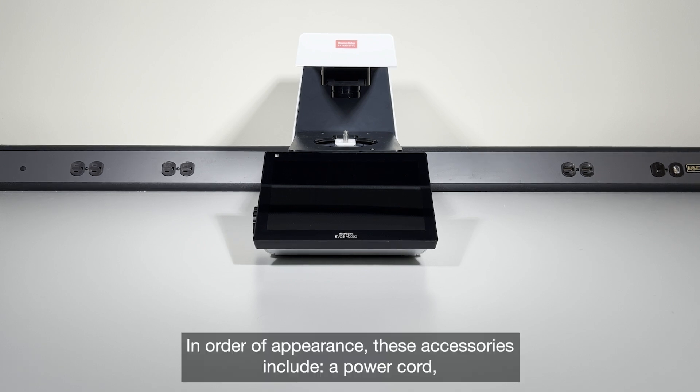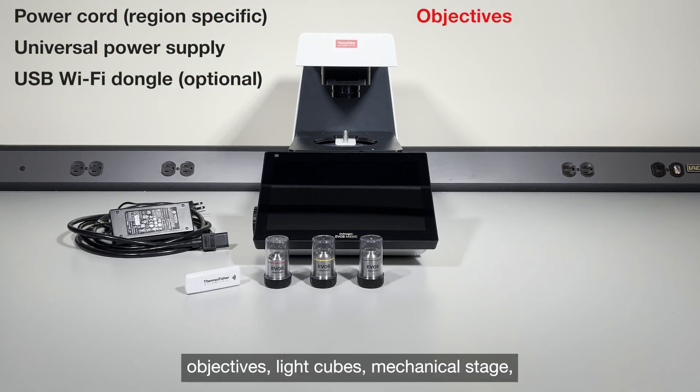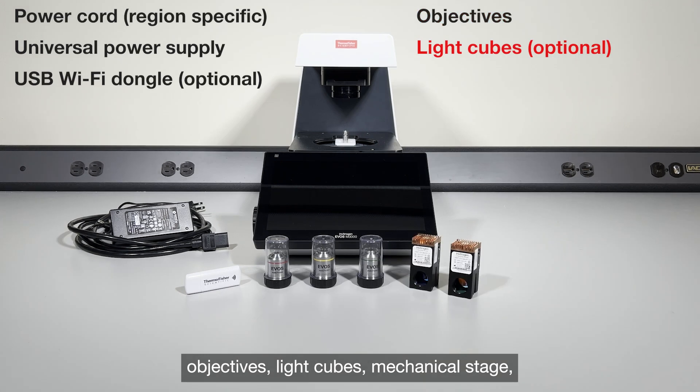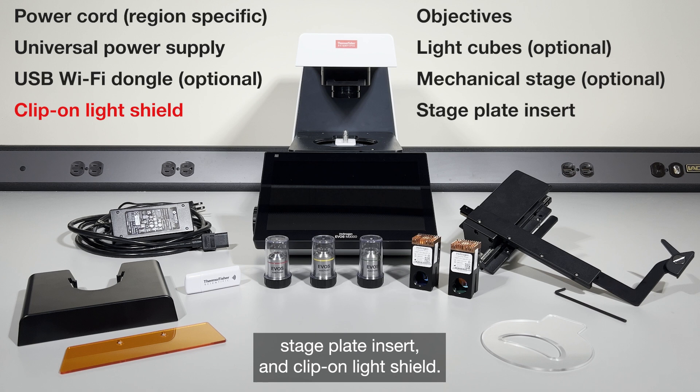In order of appearance, these accessories include a power cord, universal power supply, USB Wi-Fi dongle, objectives, light cubes, mechanical stage, stage plate insert, and clip-on light shield.